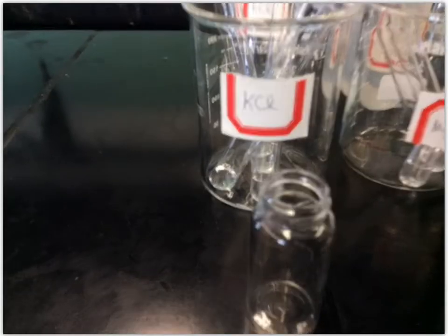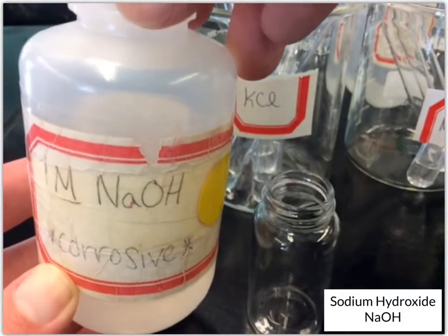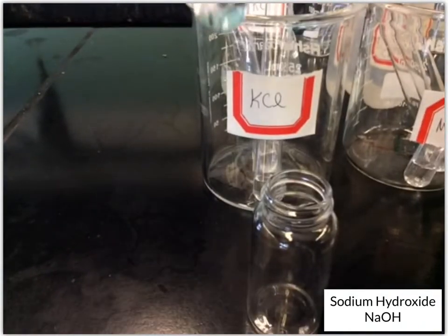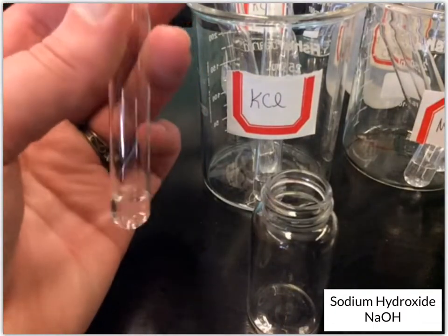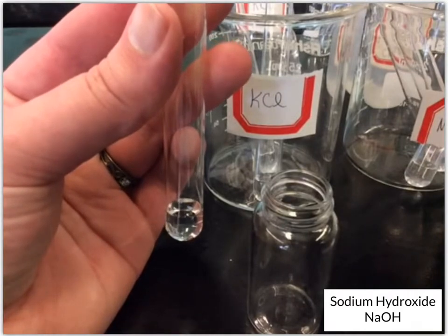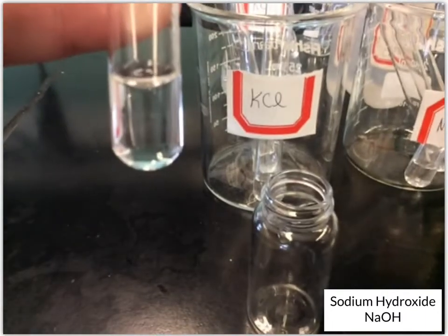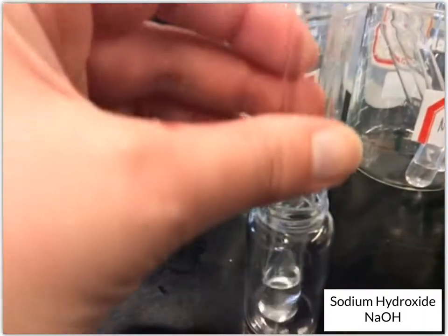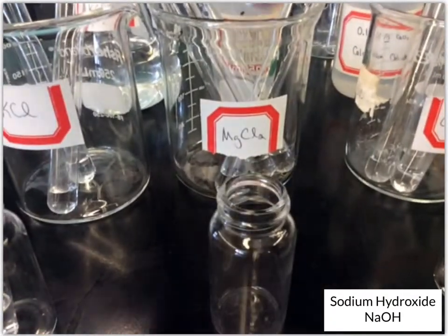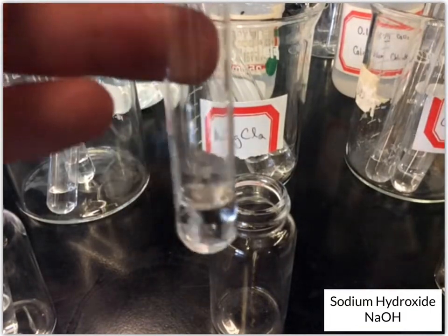Okay, next we're going to test all of these solutions with a strong base, specifically with sodium hydroxide. And so first up, we've got the potassium chloride. So just like before, I'll add about 10 drops to this. And it looks like no change, still clear colorless solution. And then next up, we've got magnesium chloride. And so 10 drops of sodium hydroxide.